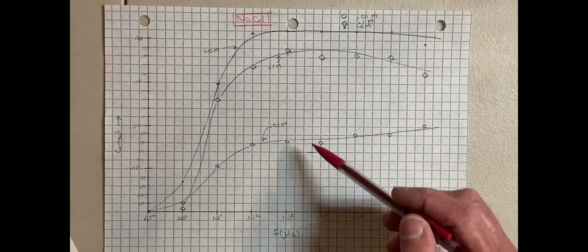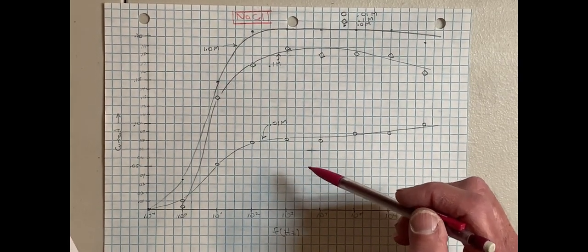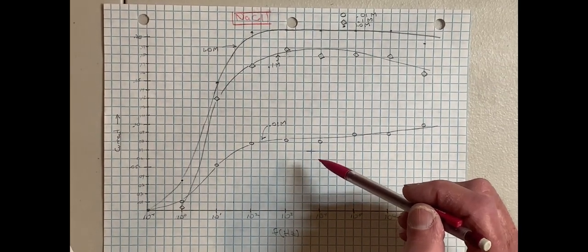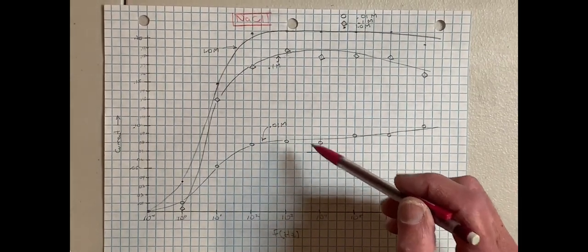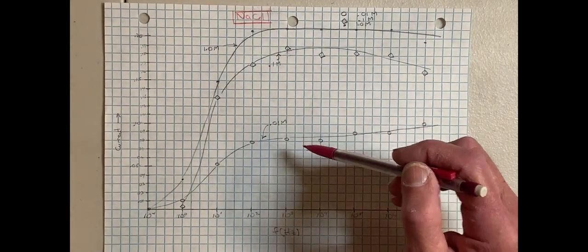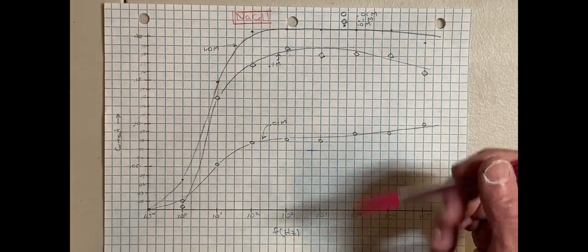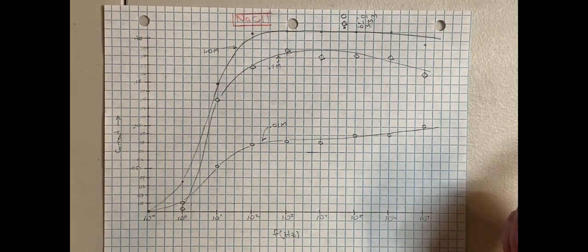Conductivity increases with solute concentration, as you'd expect with more ions in solution, but the concentration dependence is very nonlinear. Increasing the solute content from 0.01 to 0.1 molar, a factor of 10, gives you about a factor of 2 in conductance. And when you go from 0.1 molar to 1 molar, the conductance is only increased by maybe 15 or 20%. So things definitely level off at the higher concentrations.